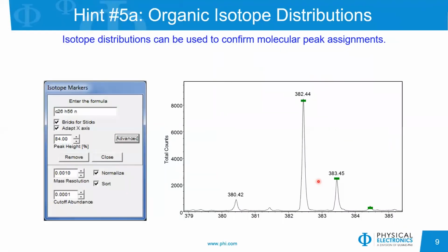And then you can carry that one step further. If you think that you have a good peak assignment based on the calibration, then you can also use the isotope tool that's built into the software, and you can put in a formula for that peak. What the isotope tool will do is put markers on your mass spectrum of what would be expected if that is a correct peak assignment. So here, the green markers are the calculated isotope distribution for a composition of C26H56N. And that looks like a very good fit. And so that gives another level of confidence in that peak assignment.